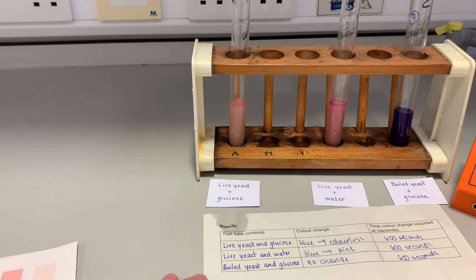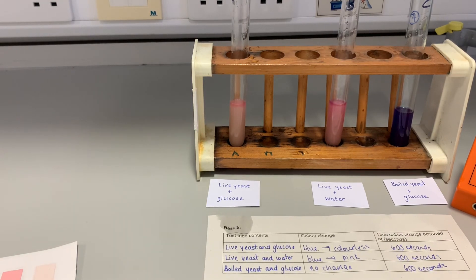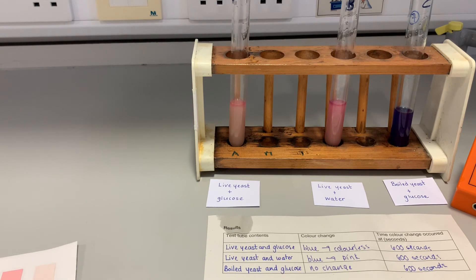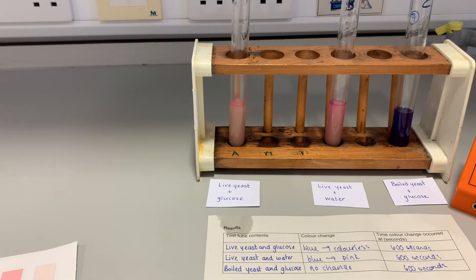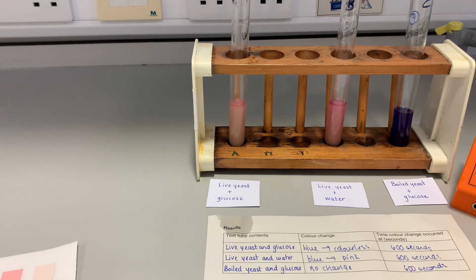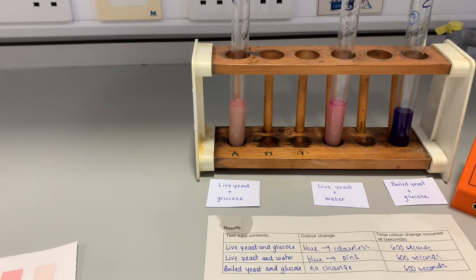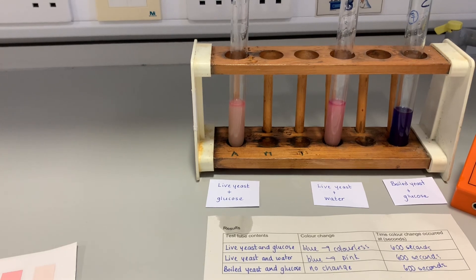Hopefully you can see from that experiment that when respiration is occurring, dehydrogenase is removing the hydrogen ions, and our indicator has changed color to show the presence of hydrogen. Lots of hydrogen is produced when live yeast has glucose as its substrate. A little bit of hydrogen is produced when live yeast is in water, because it will have some respiratory substrate within its cells. Where we boiled the yeast, there is no color change at all because no respiration is occurring — the yeast is dead and all the enzymes are denatured.